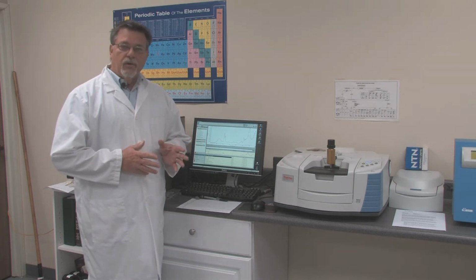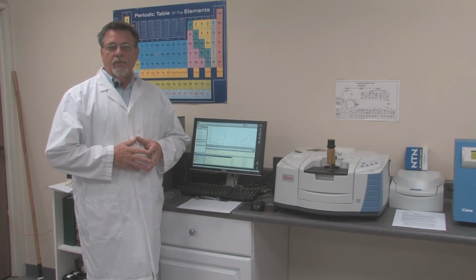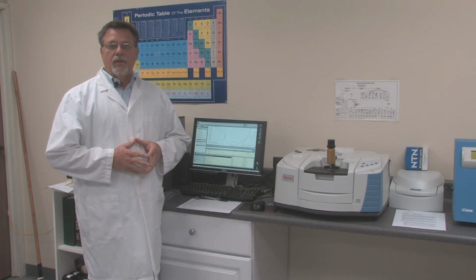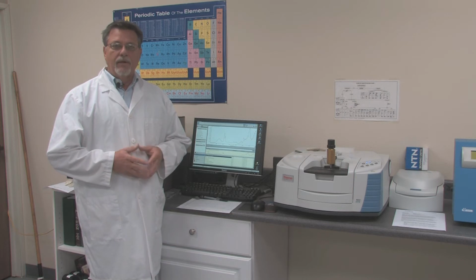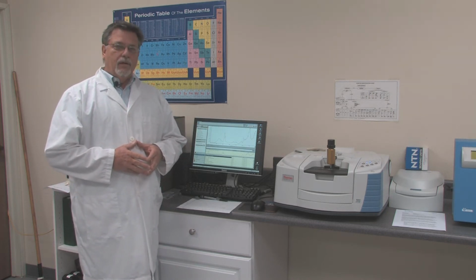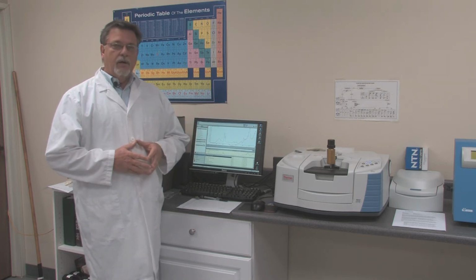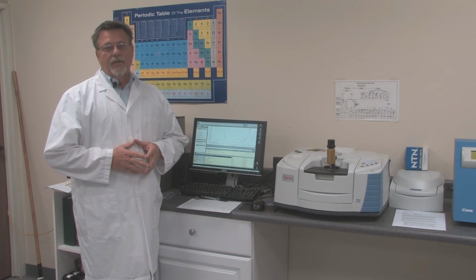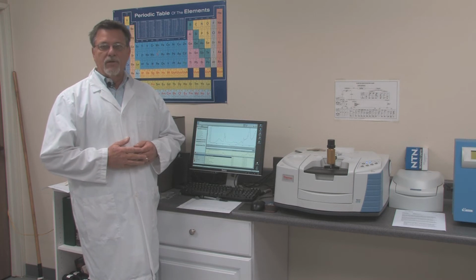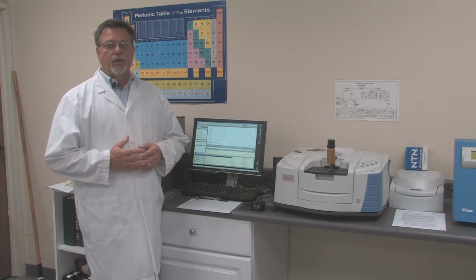This device is also very useful in terms of looking at new materials that we're developing, for instance. We can take a look at some modifications that we might be making in a fluoropolymer and determine whether or not the additions are correct, whether the additives are correct, and also see what's going on with the PTFE. There's a lot of things that we can learn looking at it through infrared eyes. Now, along with the FTIR, we can also do other types of analytical tests like TGA and DSC. These are devices that are used to look at the materials in terms of thermal properties and degradation properties. So these are some other things that we can do to assist customers and also assist ourselves in understanding what's going on with a particular material.